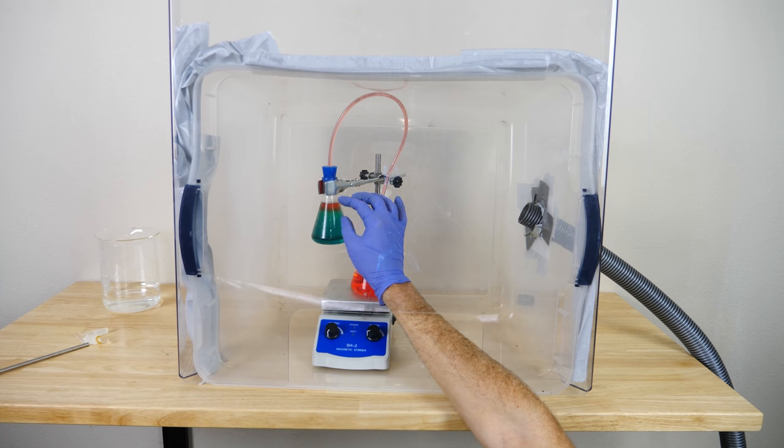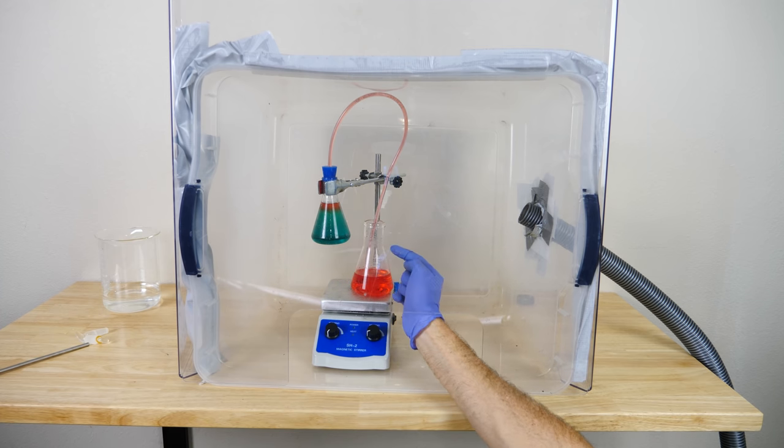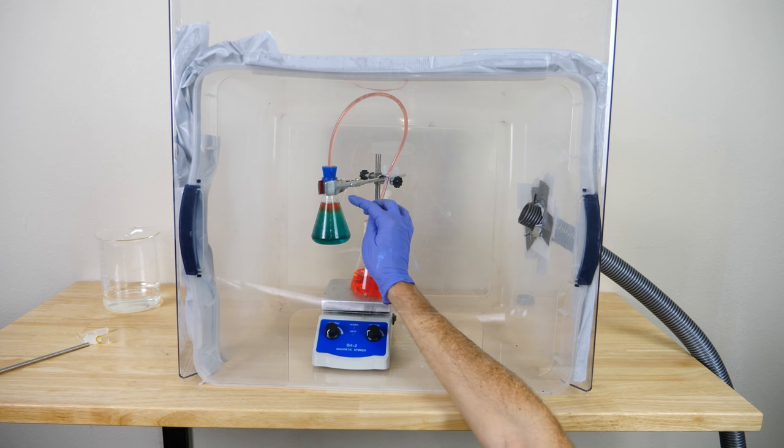And as soon as the water reaches here, then all the gas that was in this jar reacts with the water. And so it sucks it up even more until all the nitrogen dioxide gas has reacted with the water.